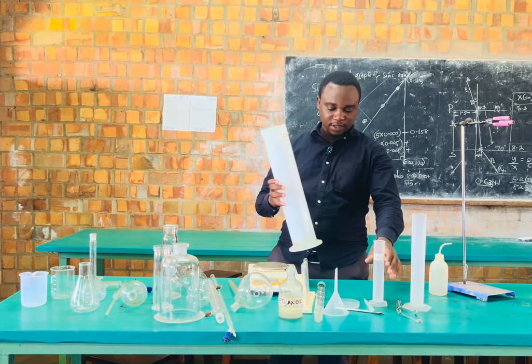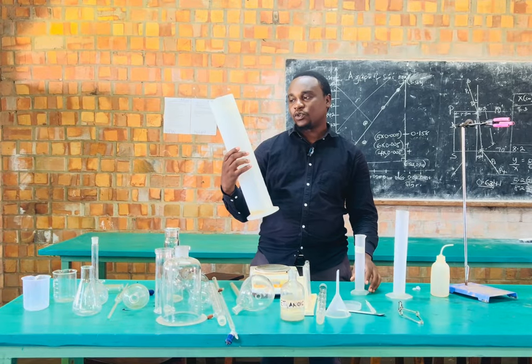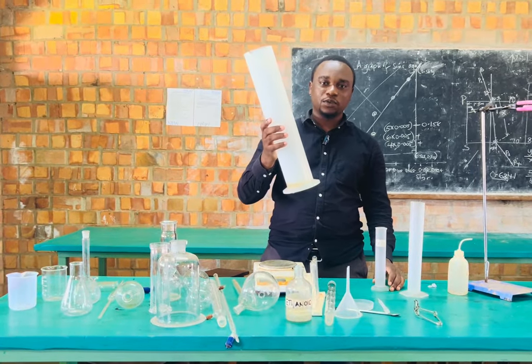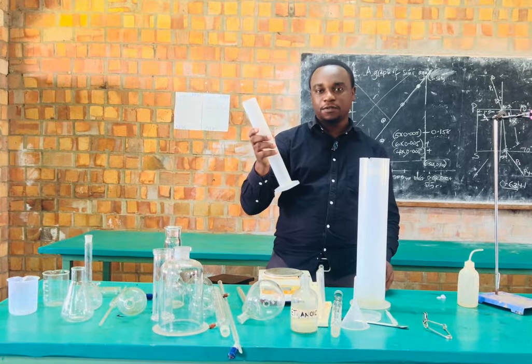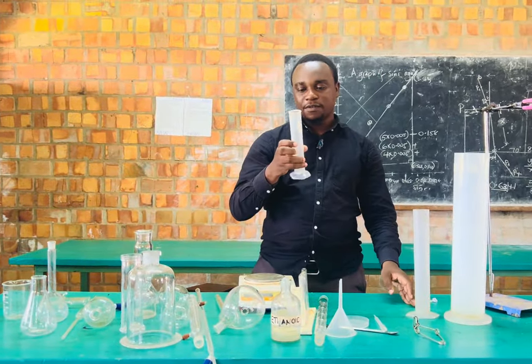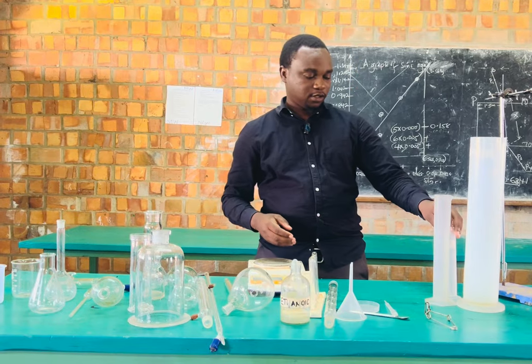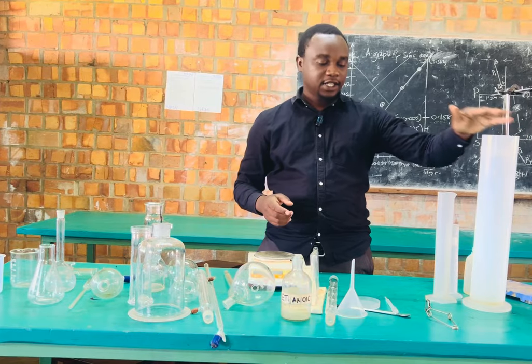We have measuring cylinders. These measuring cylinders are used to measure accurate volumes. However, they range from different sizes depending on the capacities they are able to measure. With this one, we have the one of 2 liters, which is big enough as you can see. We have the one of 250 milliliters, which is the next in size. We also have the one of 100 milliliters. So depending on the size, the measuring cylinders can be present. We even have smaller ones depending on the capacity, but they are all called measuring cylinders.